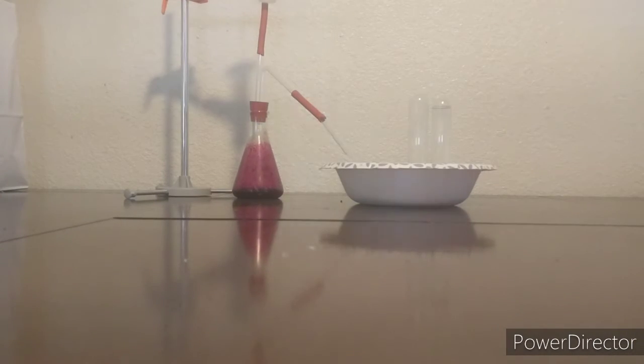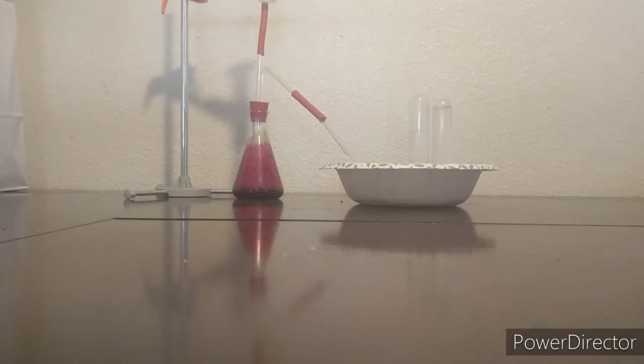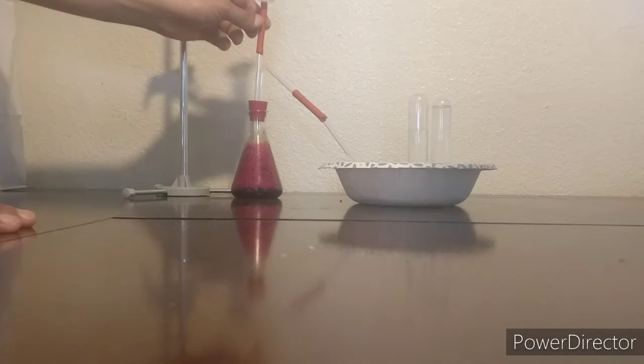I actually had two test tubes, but it's way too overkill. You should only use one test tube. There's a lot of bubbling in the beginning, but it just stops. The amount of material is important, and I think I didn't add enough vinegar.